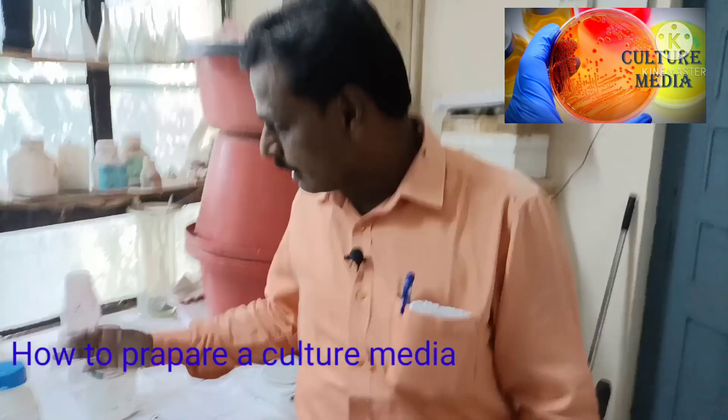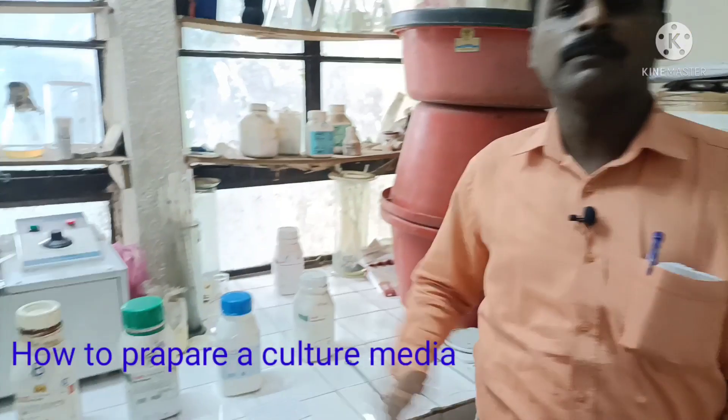Hello friends, I am Dr. Anil Narshinge. Welcome to this video. In this video you are going to learn about how to prepare a culture medium.